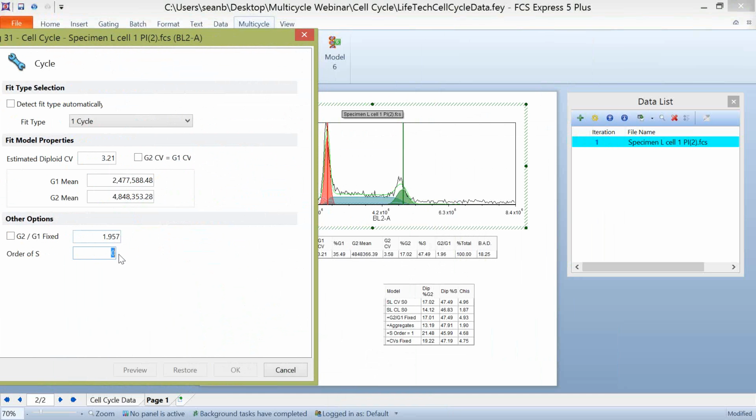If we were to change this to an S order of 1, what this is assuming is that the S phase is some sort of broadened trapezoid that's tilted in one direction or another. So when I click preview, you can see here that when we use an order of S of 1, we have this decreasing S phase. And for this data set, it doesn't necessarily make the most sense, but if you have a decreasing or increasing S phase as it progresses from G1 to G2, an order of S of 1 might be useful.